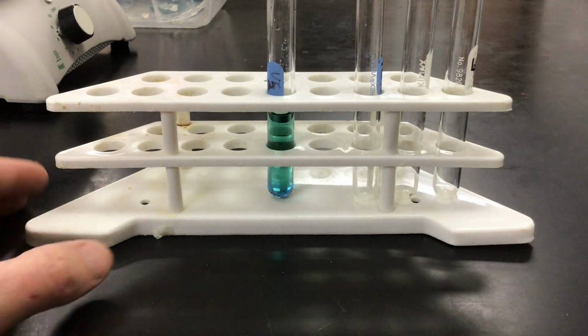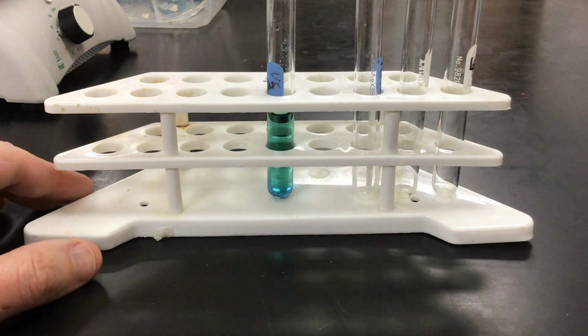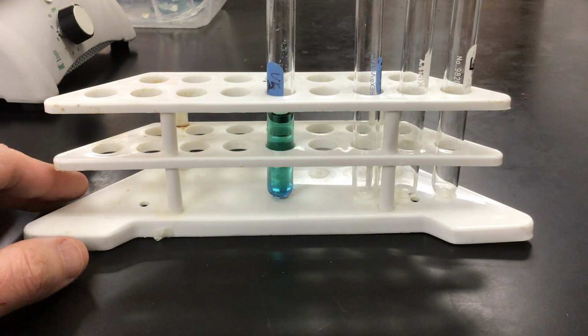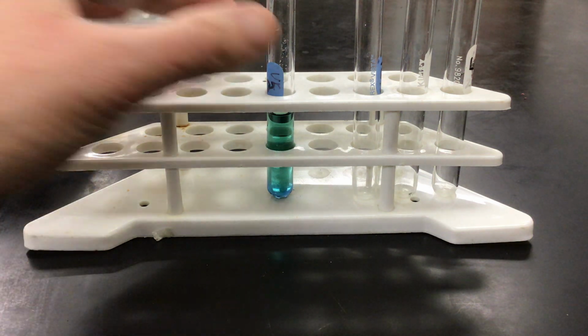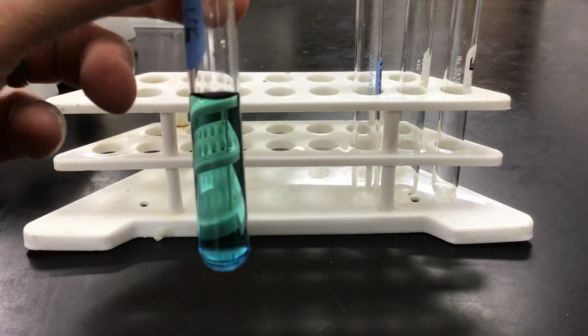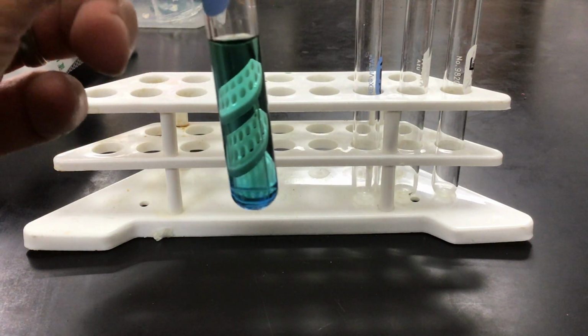All right, in part 2 of LeChatelier's Lab, what I have here is distilled water in which I added bromothymol blue, which is an acid-base indicator. It turns color as you change the pH of a solution. Currently, you can see the color of the solution right here. It's kind of got a greenish, maybe aqua color to it.